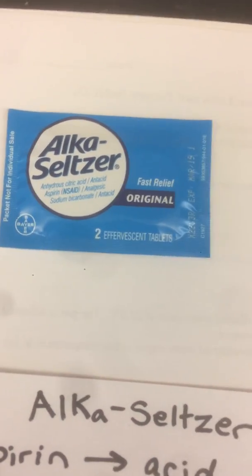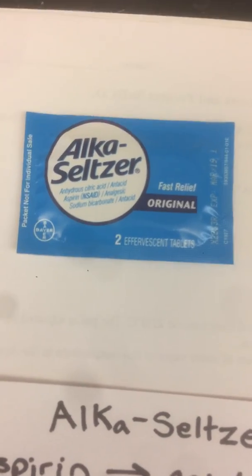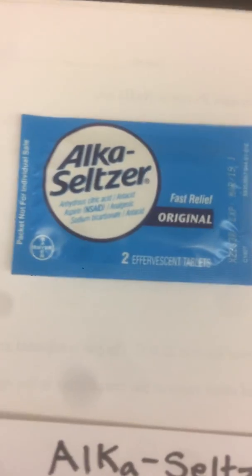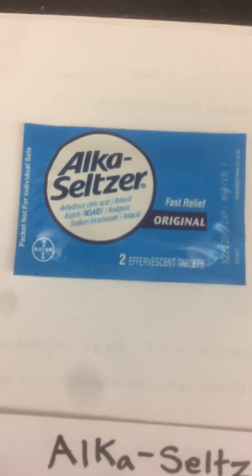Hello, I'm Chris Ambrose. This is going to be your virtual lab experience for the Alka-Seltzer Lab. So I'm going to give you a little bit of background on the lab. I'm going to run the two experiments and provide you with some data.